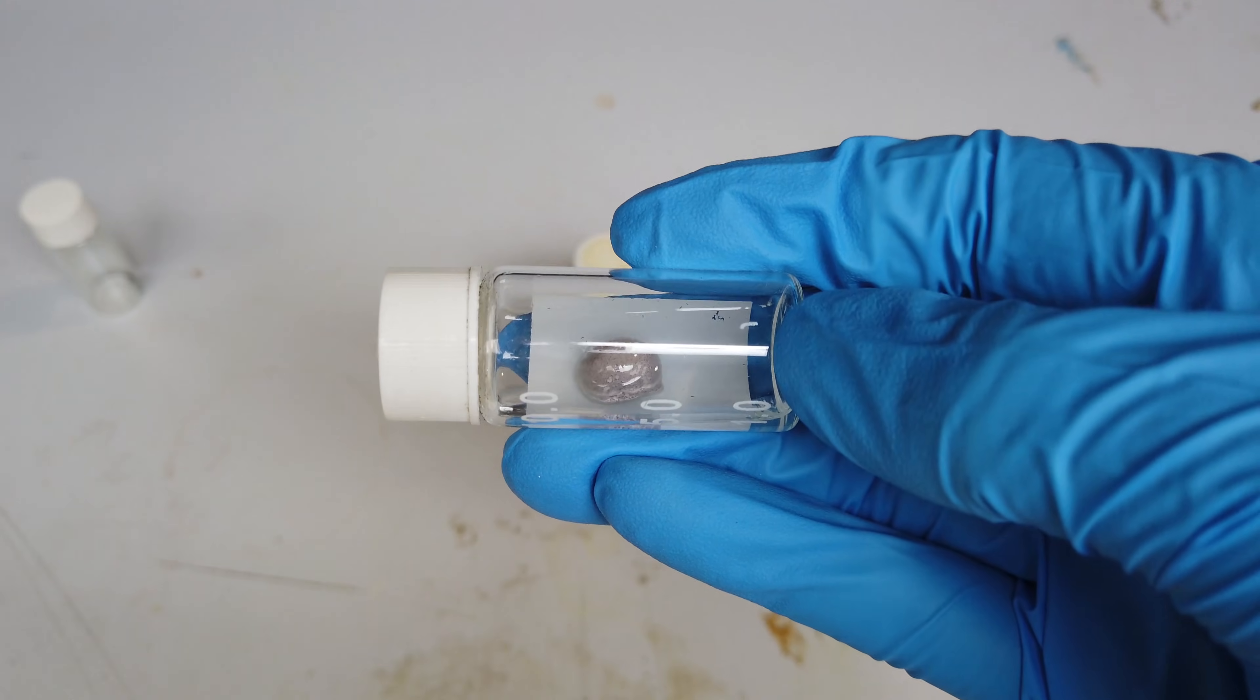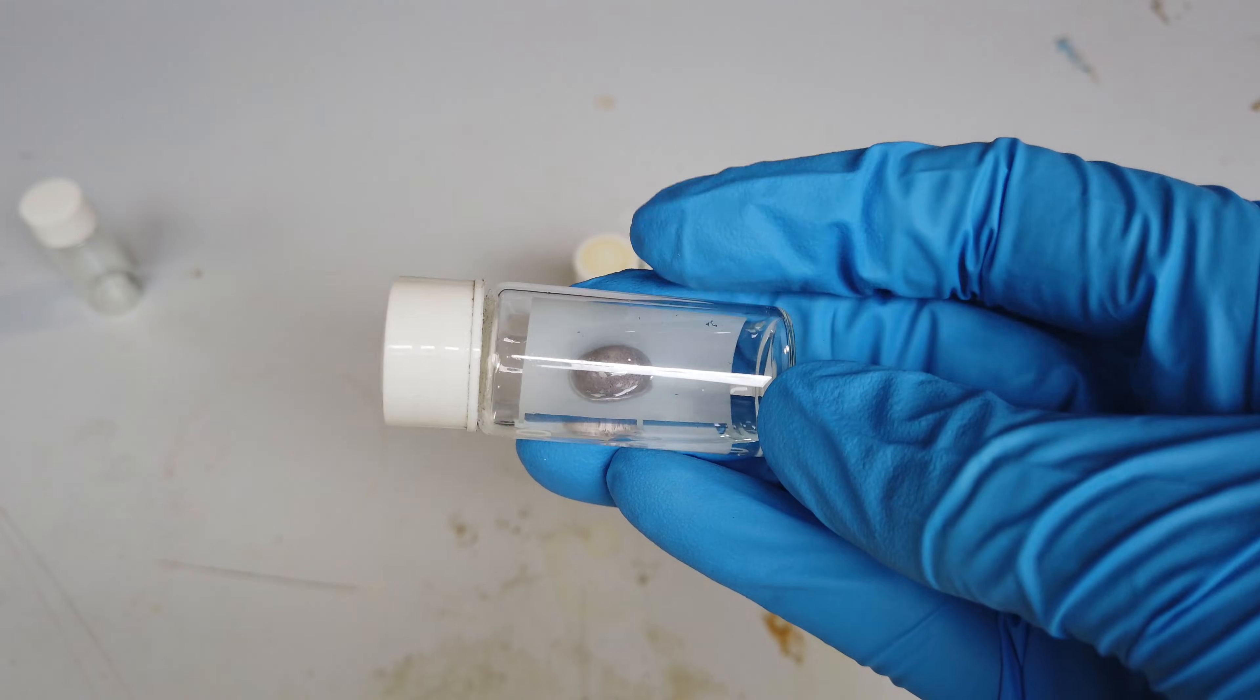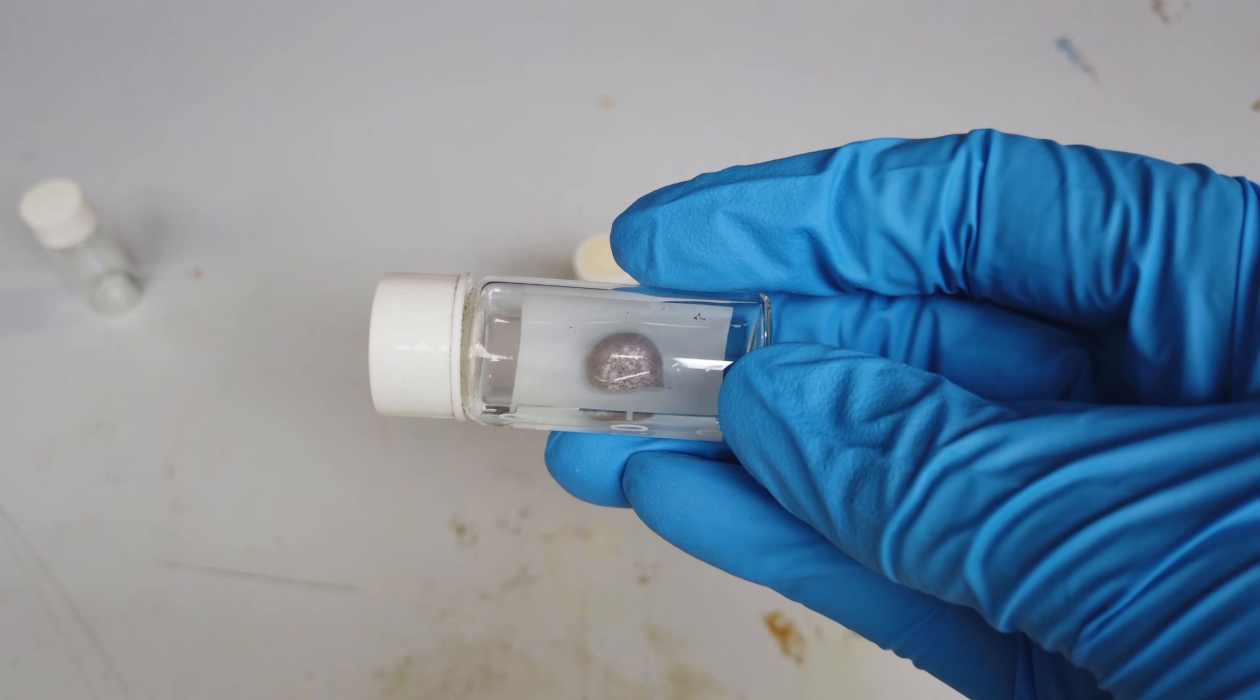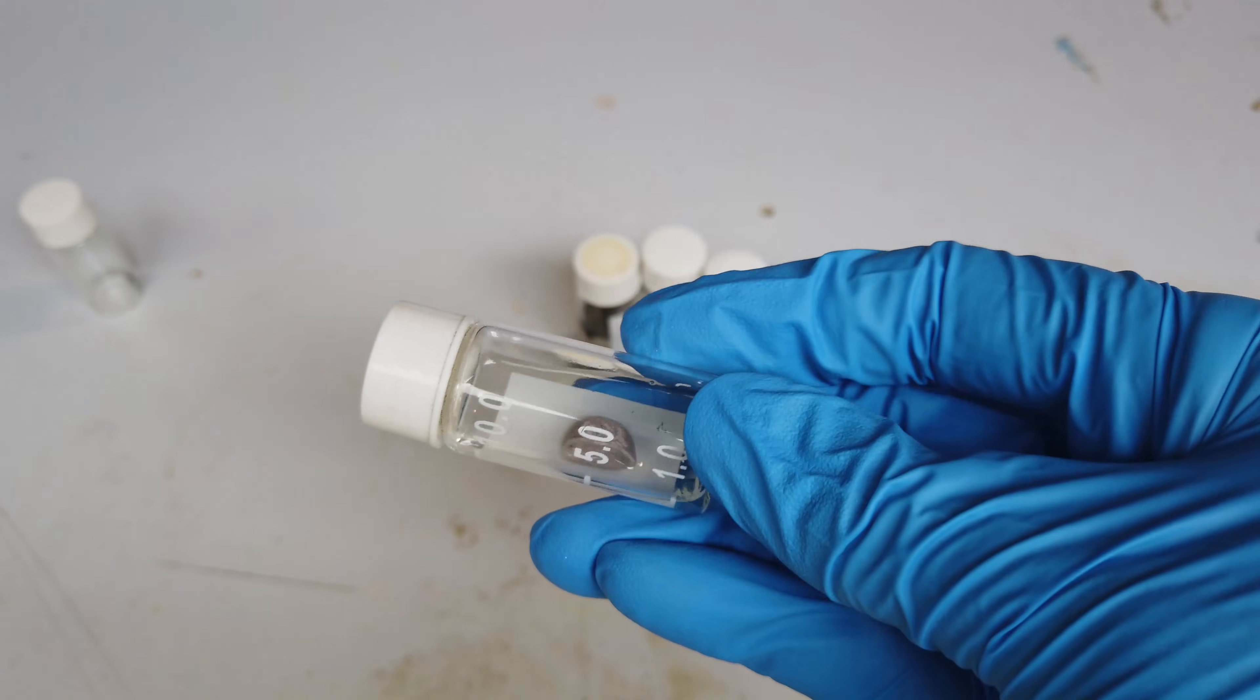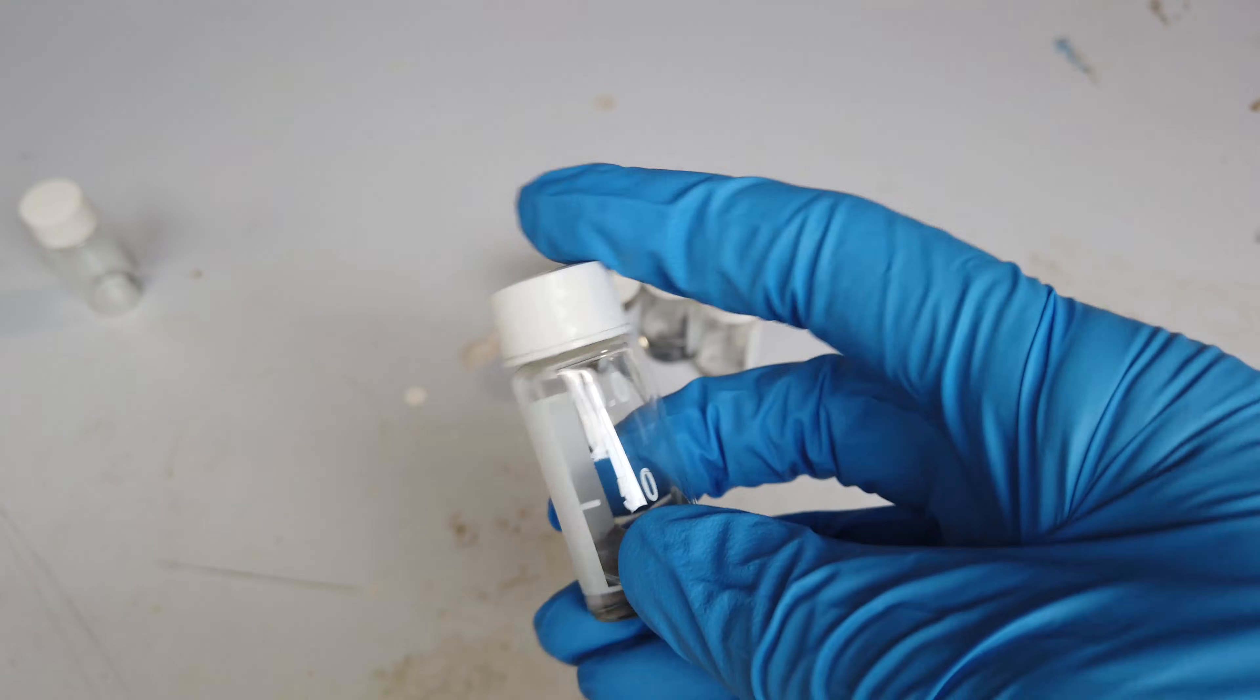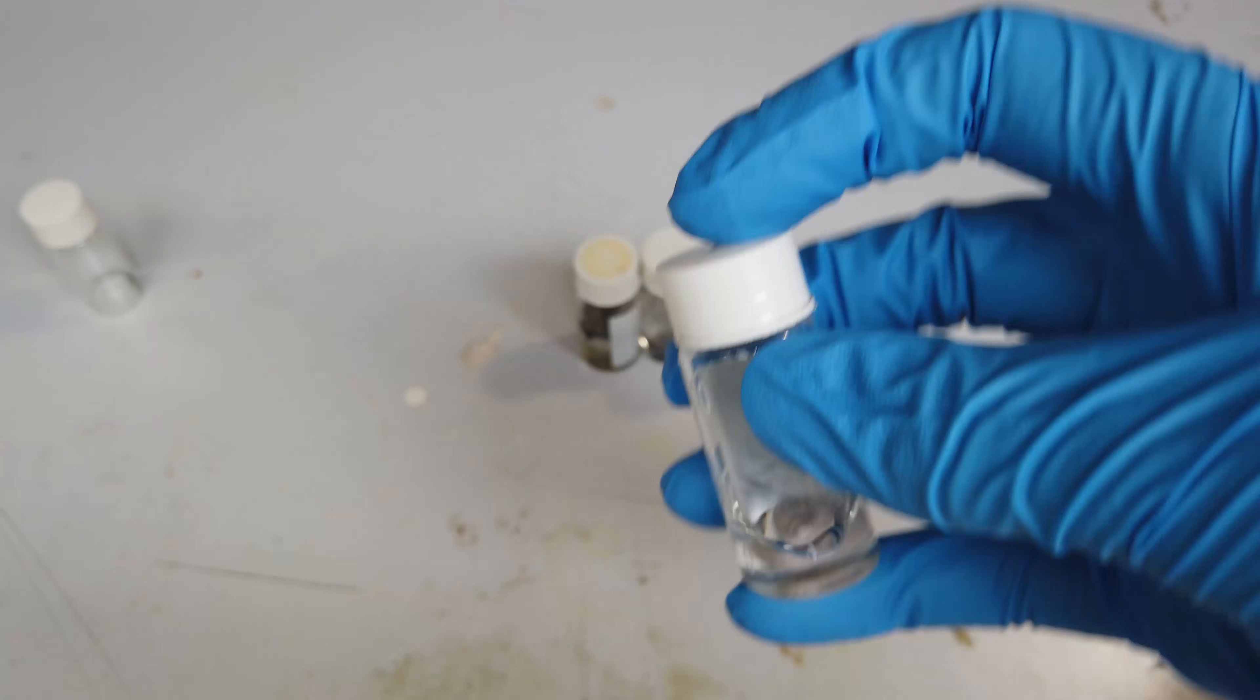Then we made some sodium as well. This is a bead of sodium that I made from the electrolysis of Molten Sodium Hydroxide. This is stored under oil and it seems to have fared pretty well in the multiple years since I made this, so I don't think that needs much work.